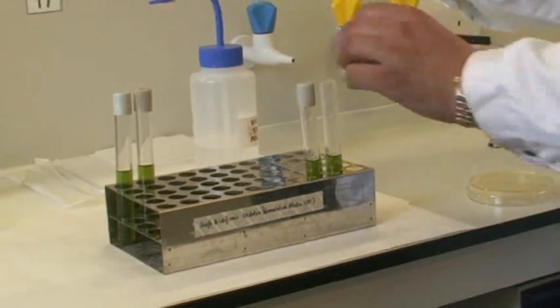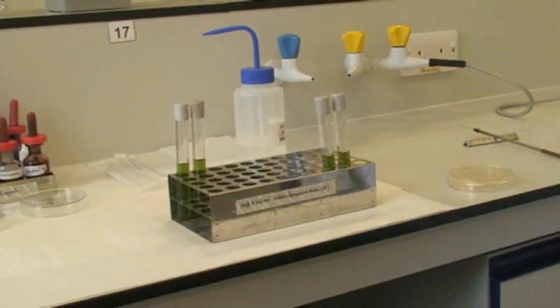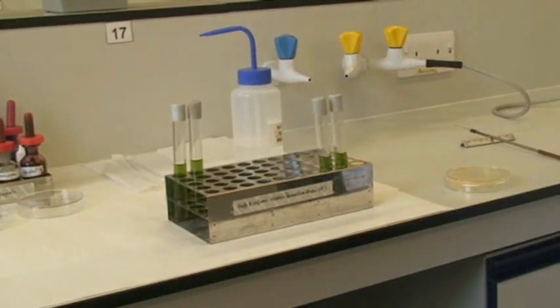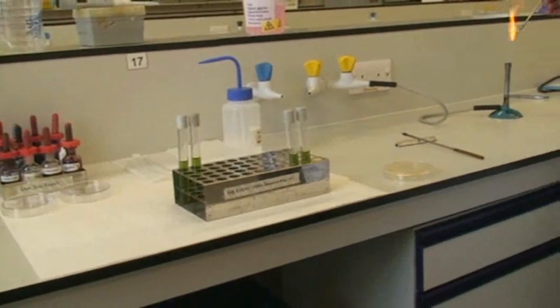And what we're going to be demonstrating with Hugh and Leifson's media is how to incubate bacteria aerobically and anaerobically.